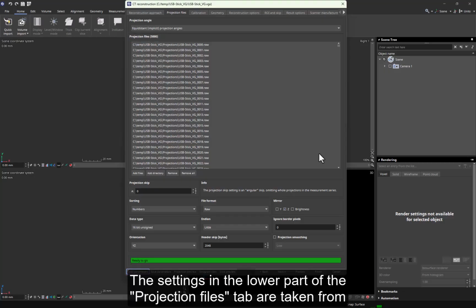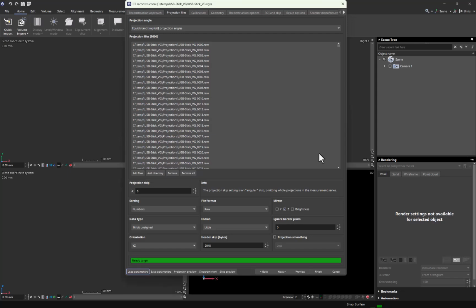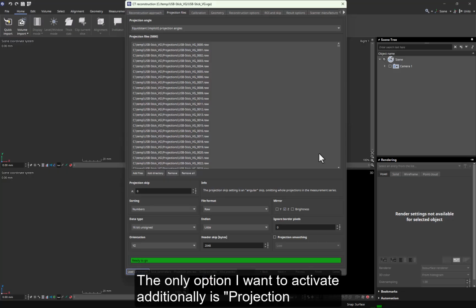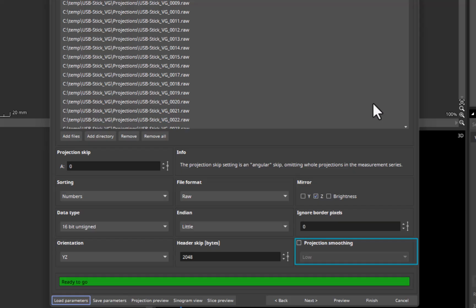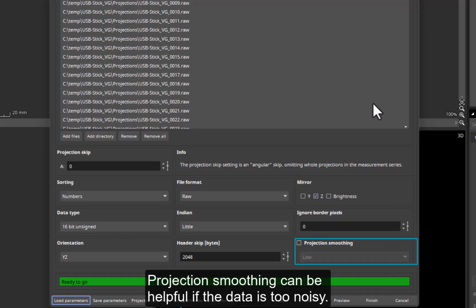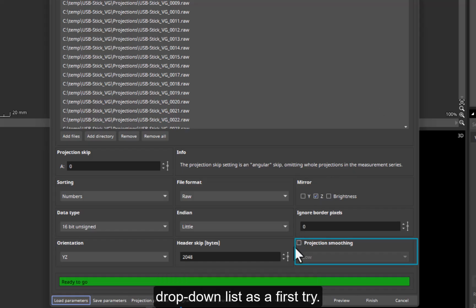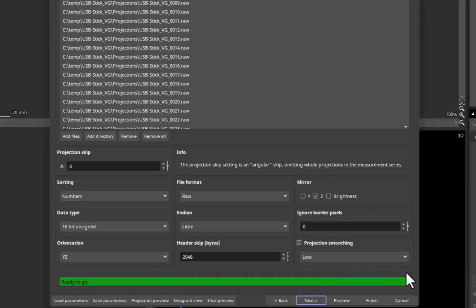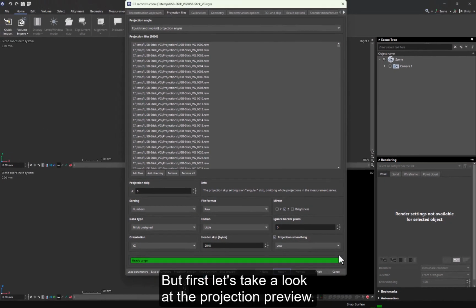The settings in the lower part of the Projection Files tab are taken from the header of the projection files and should already be set correctly. The only option I want to activate additionally is Projection Smoothing, here at the bottom right. Projection smoothing can be helpful if the data is too noisy. I'll activate the checkbox and select Low from the drop-down list as a first try. We will view the result later in the slice preview. But first, let's take a look at the projection preview.